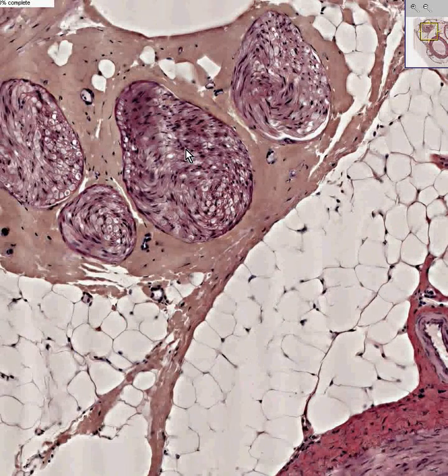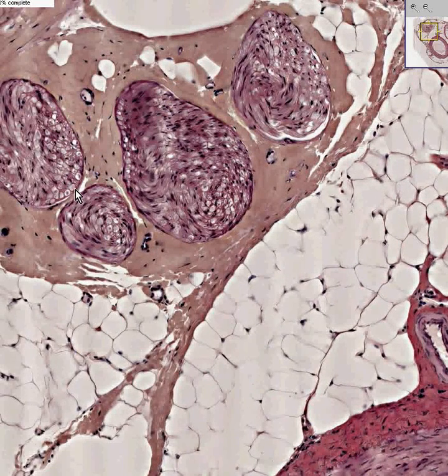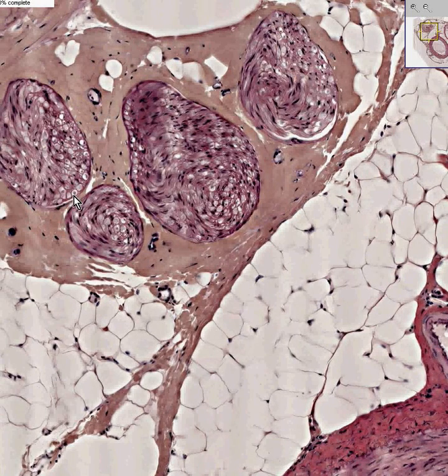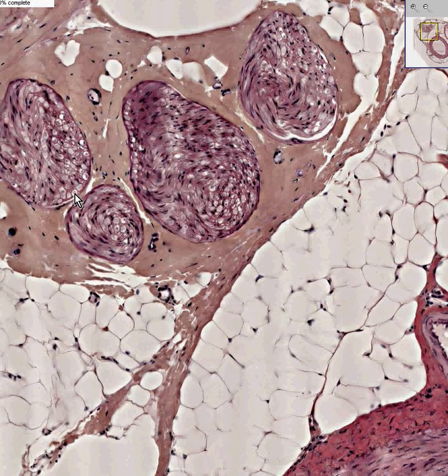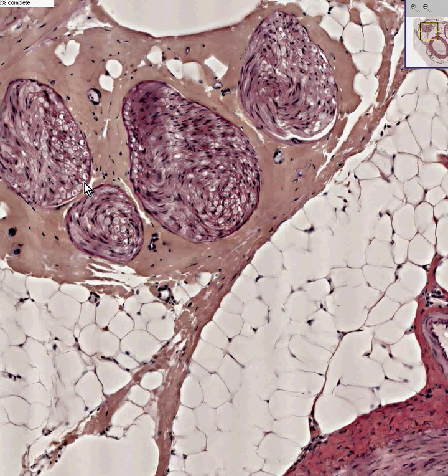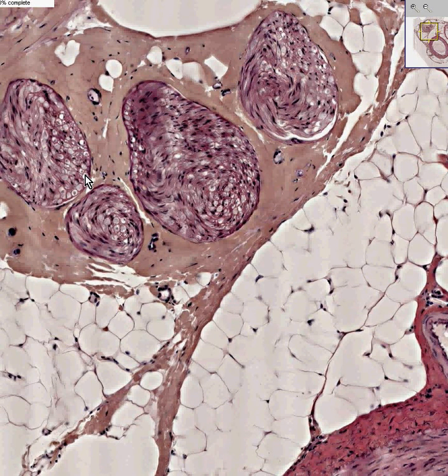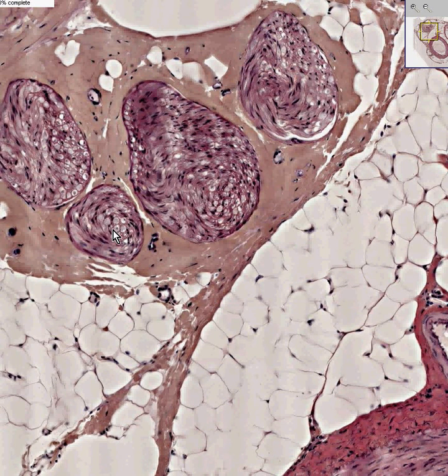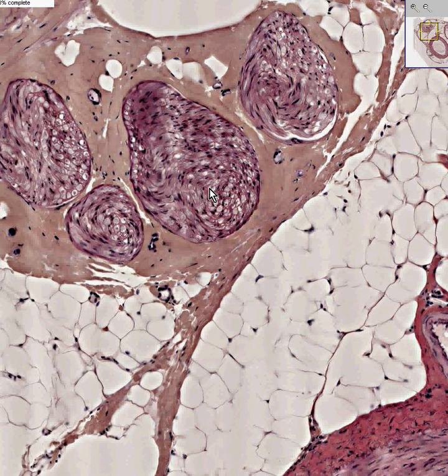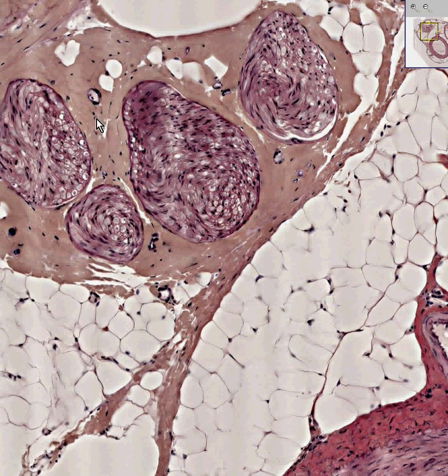You could see the Schwann cells are nothing but little insulations surrounding these individual little axons. Here's an axon, here's an axon, here's an axon. And the Schwann cells are the cells that surround and insulate and protect the axons.